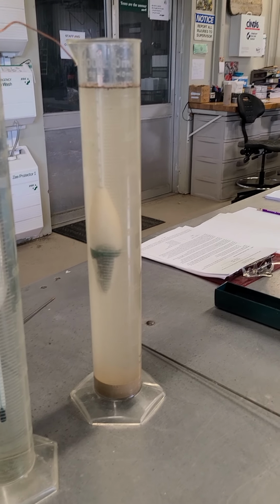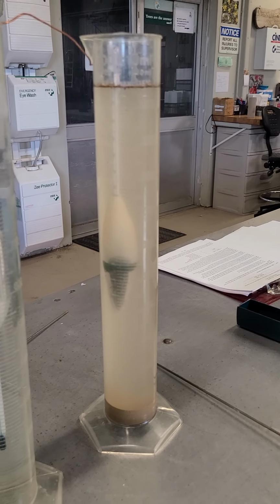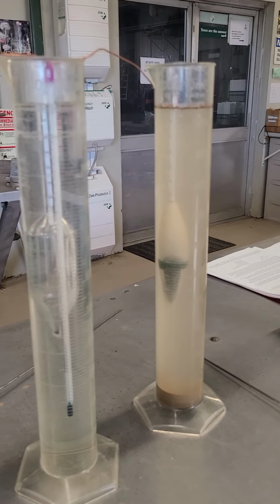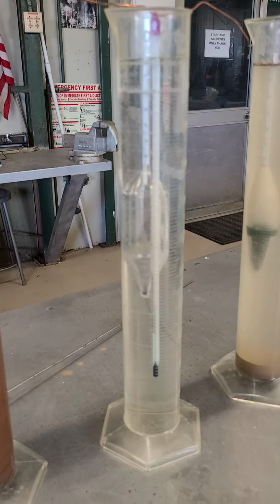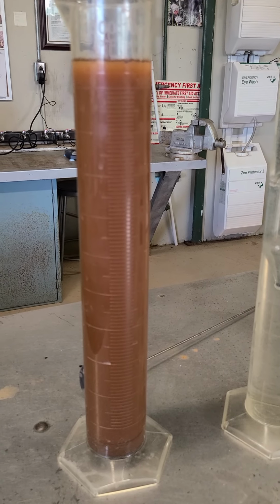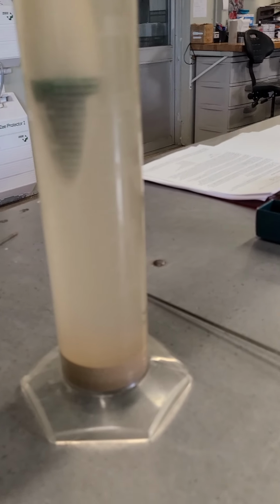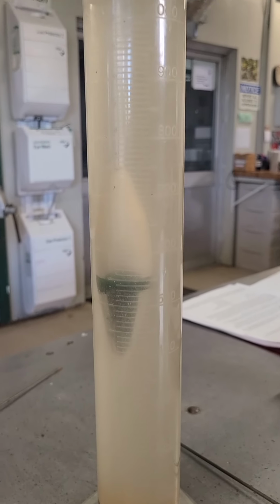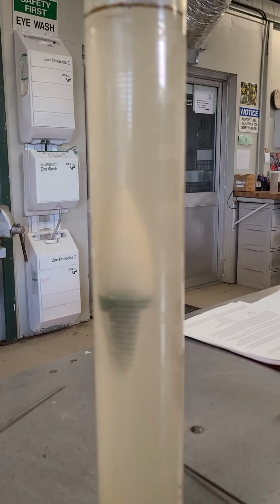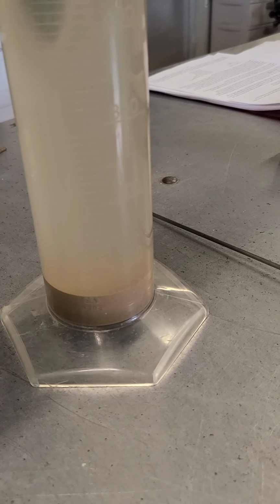All right, well, here we are 3 hours later, and you can see there's quite a change to our samples. Here's our first sample, and there's our blank, and then here's our other sample that you didn't watch me do. But you can see there's quite a bit of difference. Let's go ahead and zoom in on this first sample here. You can see the hydrometer in there, and you can see that it's almost clear. So what do you think that might tell you?